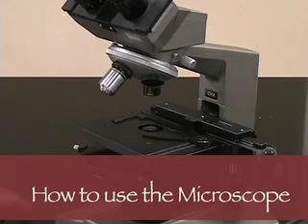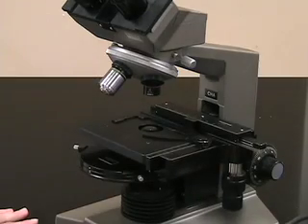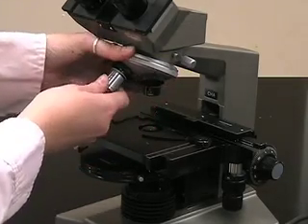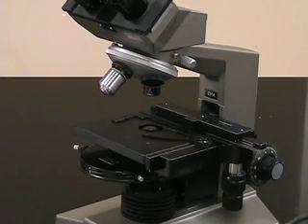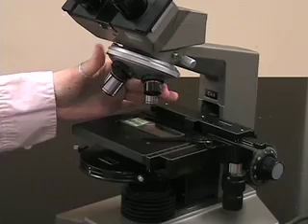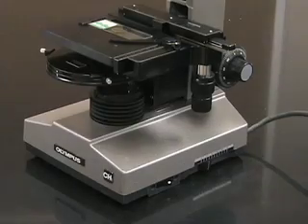Now I'm going to tell you how to actually use the microscope. After removing it from its cubby, the first thing you can do is plug it in. You want to make sure that the objective lenses are set to the 4x objective lens. The reason is that if one of the longer lenses is down when you put your slide on, you might actually damage your slide. So it's important that when you first start, the 4x lens is pointing down.